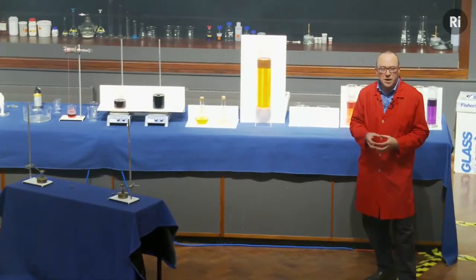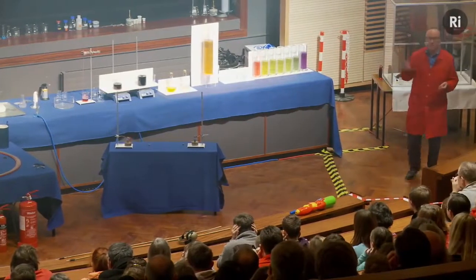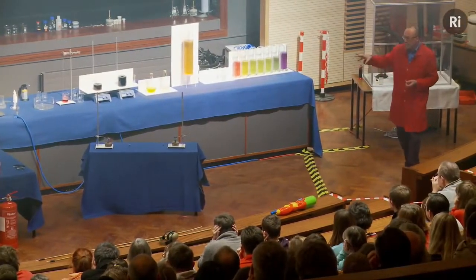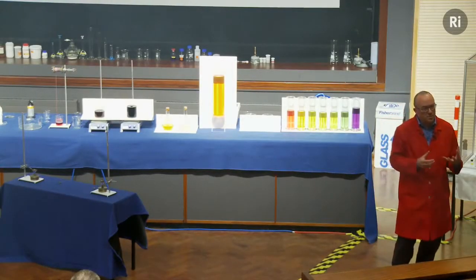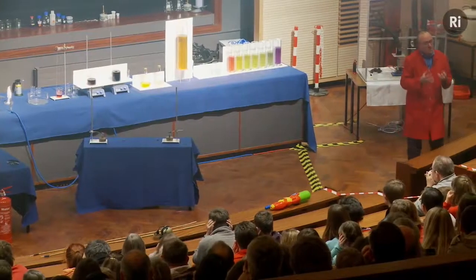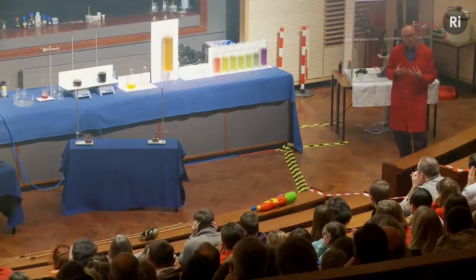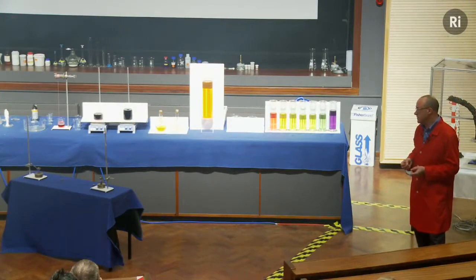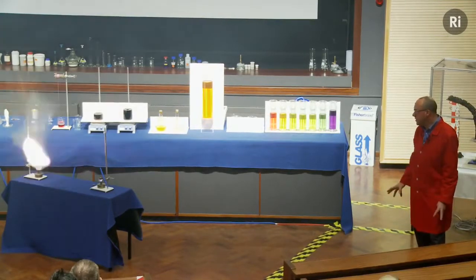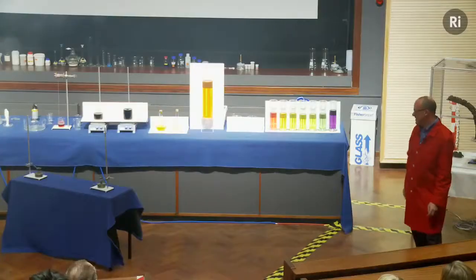Now, as the spoons heat up, at some point the gunpowder will get hot enough that it will ignite, and we'll see a puff of smoke. The yellow powder is a little bit different. Inside that spoon, the materials are starting to melt, they're flowing together, and some chemistry is taking place. The chemical composition is actually changing as a result of being warmed up. And at some point, that new mixture of chemicals should give rise to a little explosion. So it looks as if the gun... and a beautiful smoke ring.